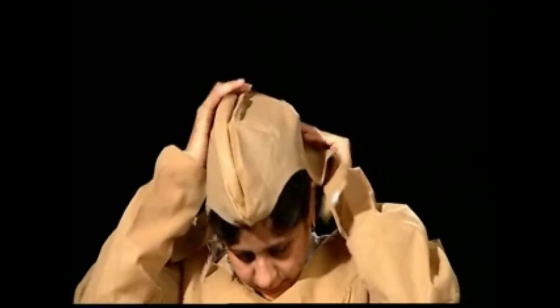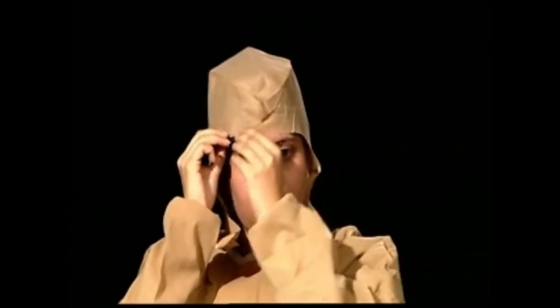Apply the headgear once the gown has been properly fitted. After placing the head cover correctly, put the hair in place. Ensure that hair doesn't stick out of the headgear. Fix the sides and apply the velcro locks.